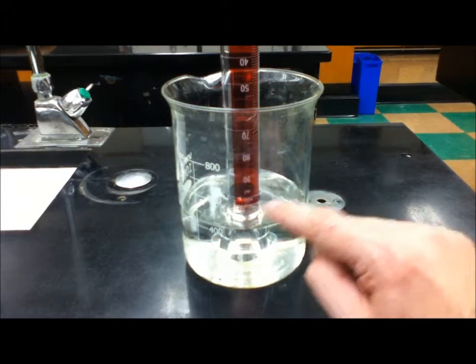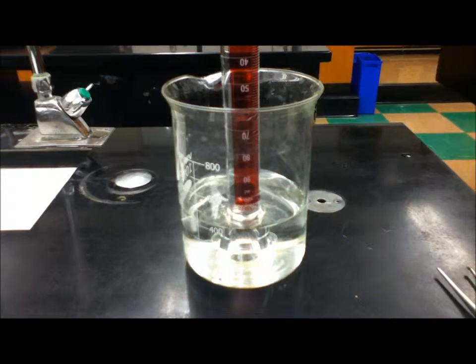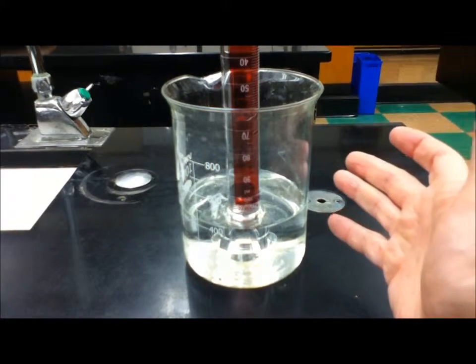The top level of the water is at that hundred mil marker, and what we're going to do is leave this for a few days.